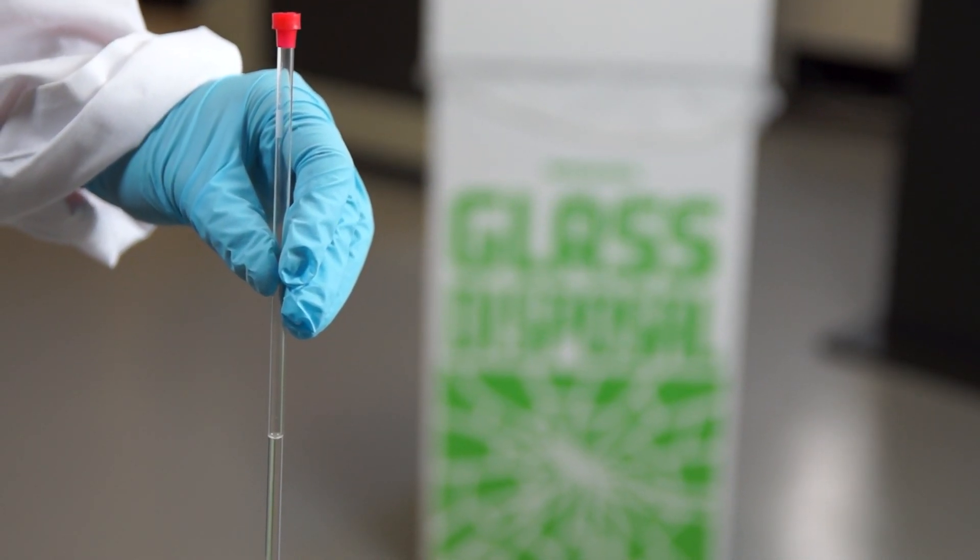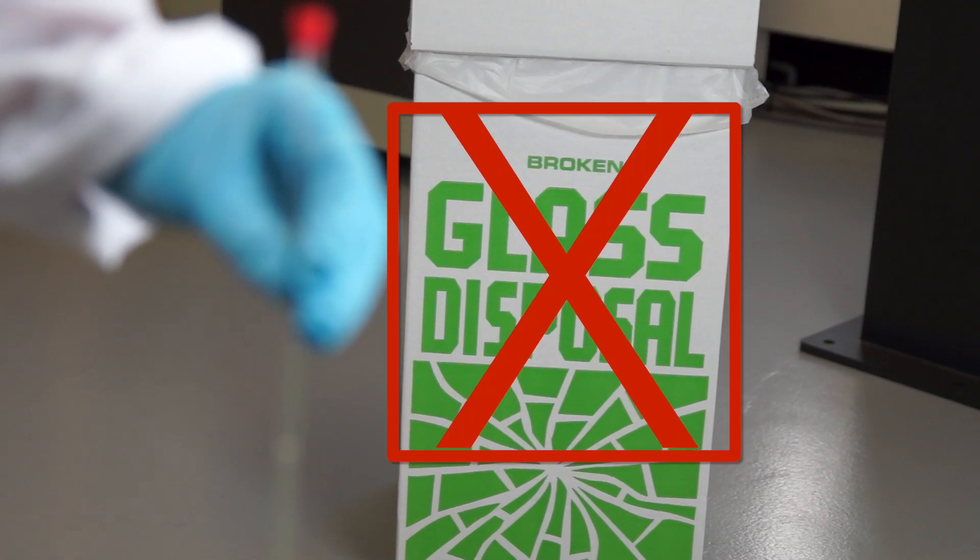Remember, NMR tubes are not disposable. They're reusable, so never place them in the glass disposal.